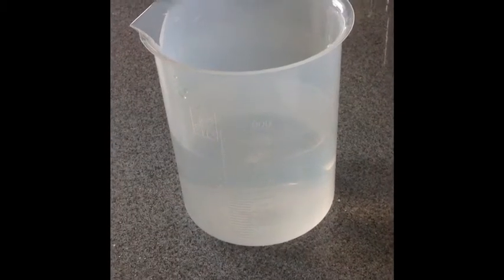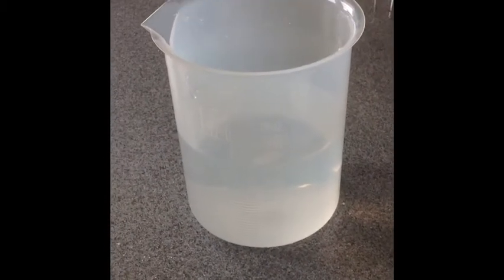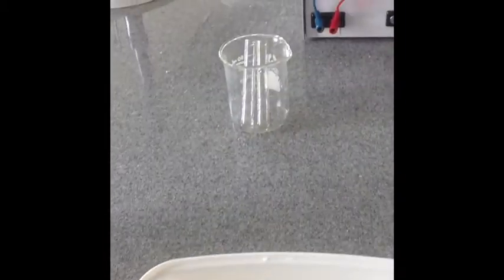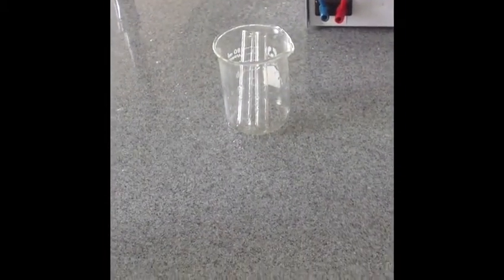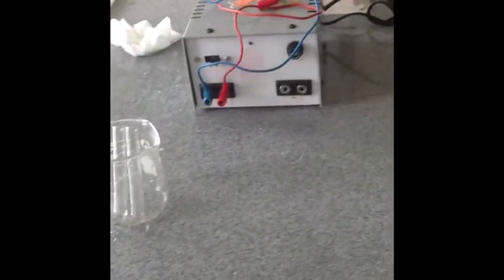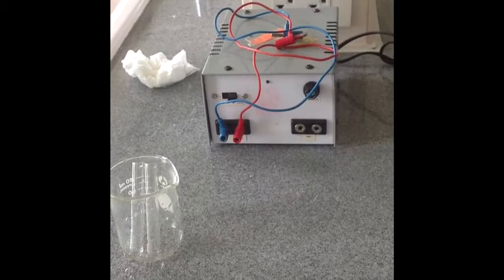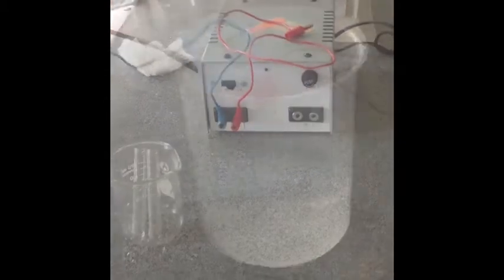For our materials list, we have a big beaker of water, salt, a smaller beaker, and two test tubes. And we have a power supply with two electrodes plugged into it.